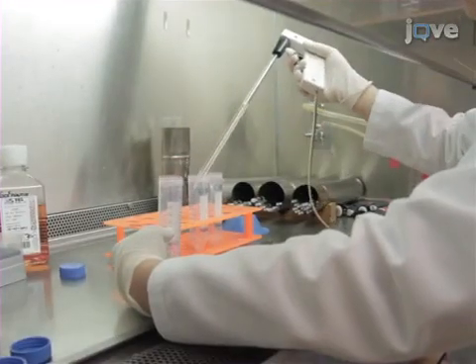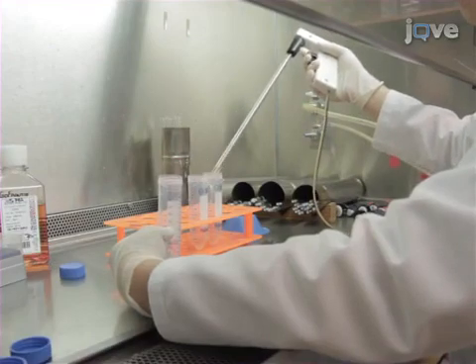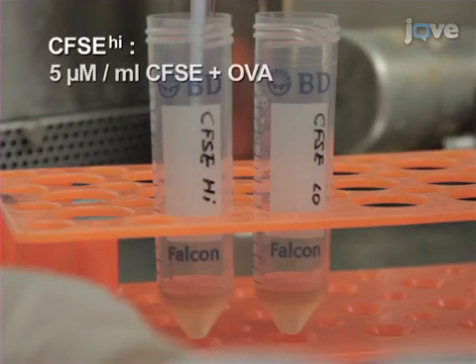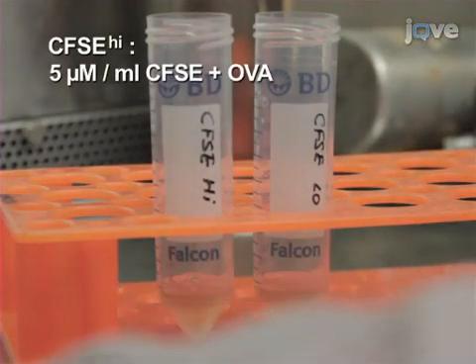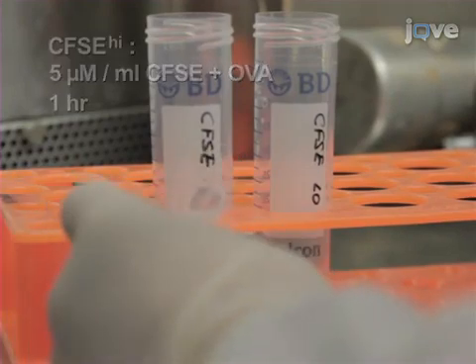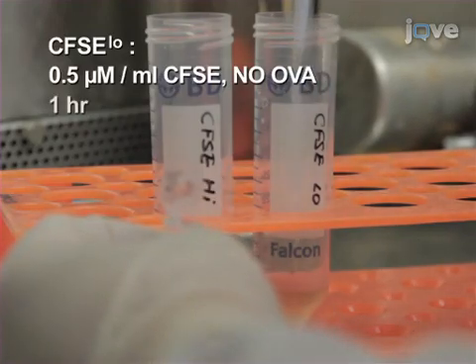After isolating splenocytes from a naive C57 Black 6J mouse, split the cell suspension into 2 groups. Label the CFSE high group with 5 micromoles per mil of CFSE and pulse the cells with 10 micrograms per mil of ovapeptide for 1 hour. Label the CFSE low group with 0.5 micromoles per mil CFSE and do not pulse.